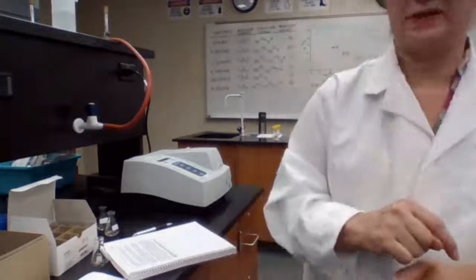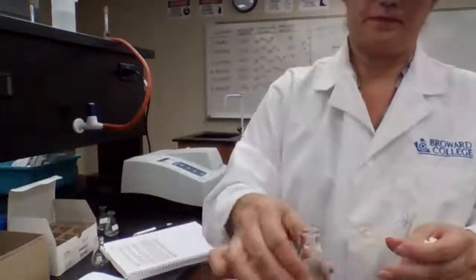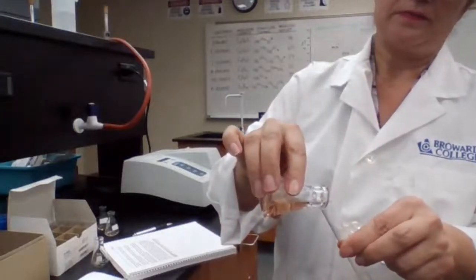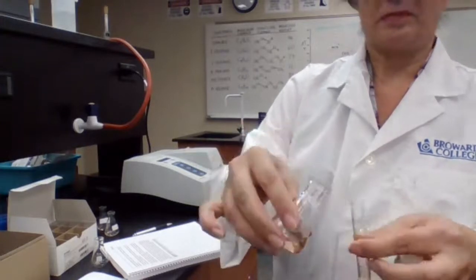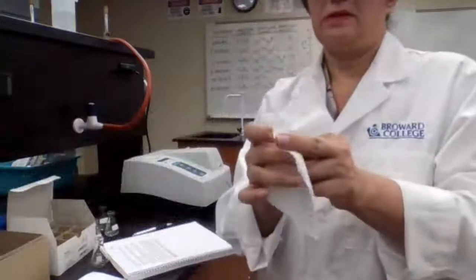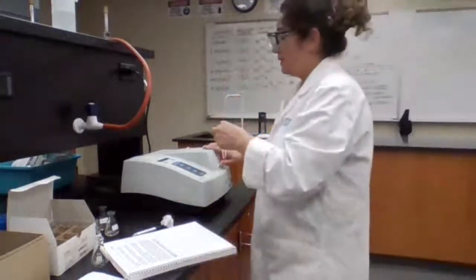I'm looking at the time, not you guys. I don't wear a watch, so I check the time from the computer. 2:09. Let me finish my calibration first. Okay, sample E is ready. Time is 2:09.